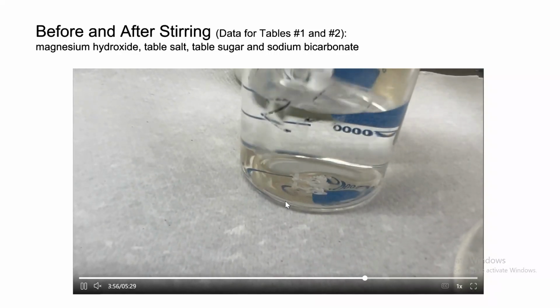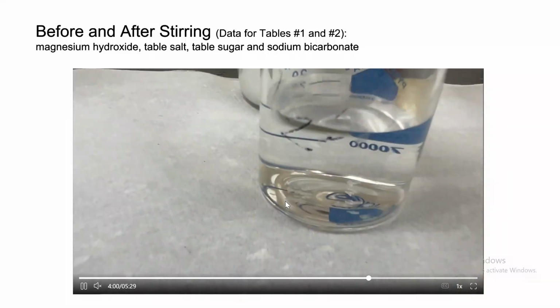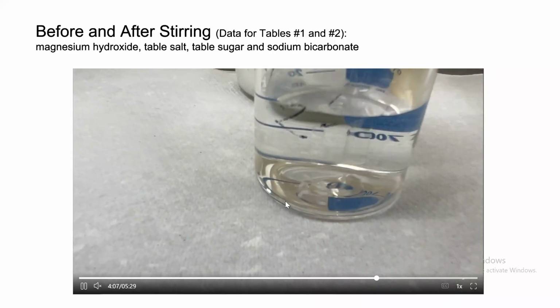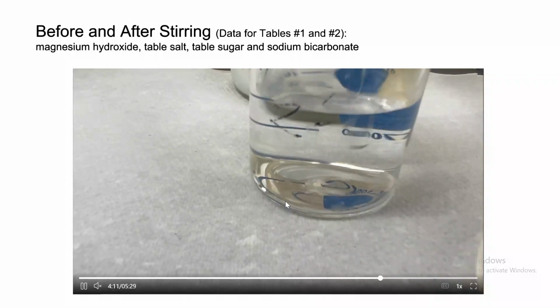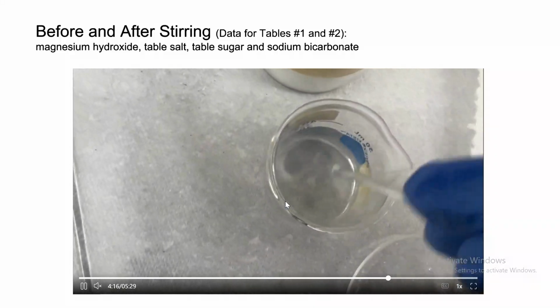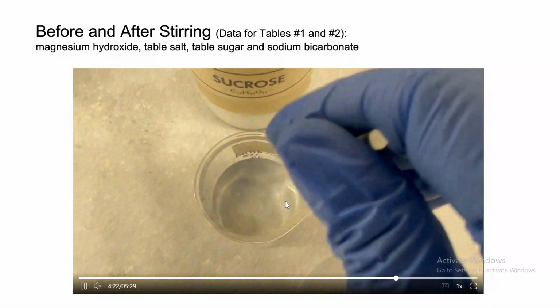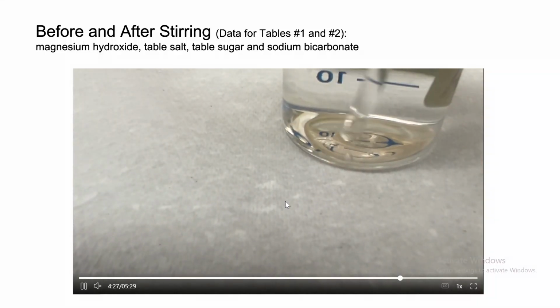We still have a few crystals, and that's understandable because the water took the maximum amount that it could. We're trying to get the last piece, but there is a maximum limit.